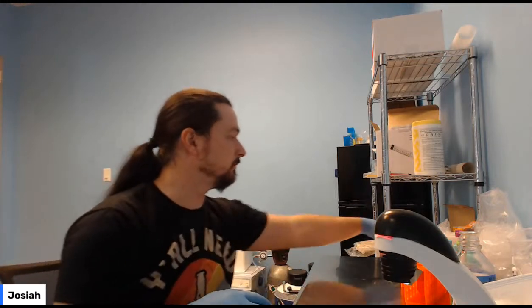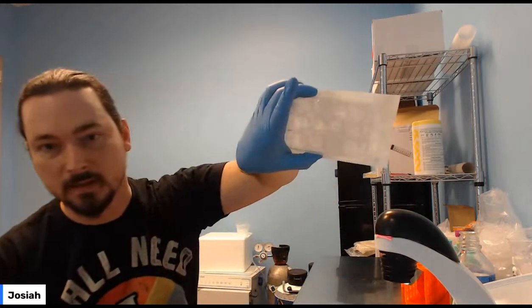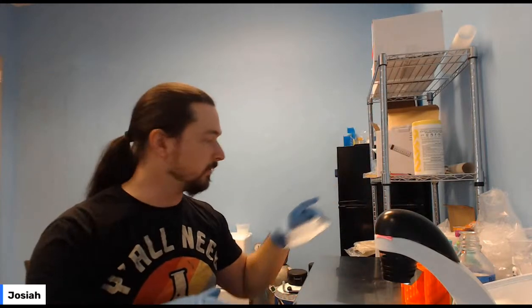So last week you should have made a plate, like one of these, selected with different concentrations of G418, which is an antibiotic, and then with the screen of those different concentrations, have a sense of how much it takes to kill those cells.